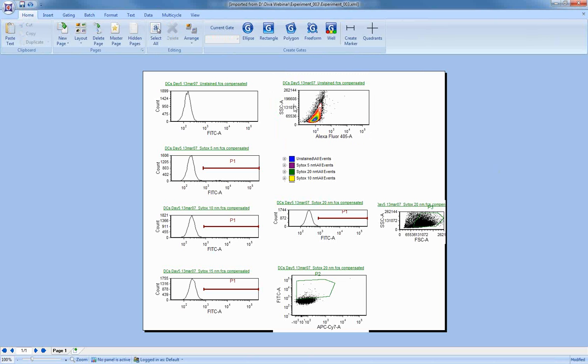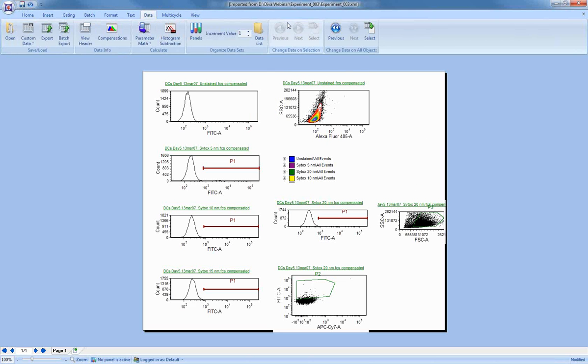The other thing that happened here when we imported it is that all of the files in that folder were imported. So we can go through, using our previous and next, and change the data files on all. Again, these are other topics related to FCS Express. We have many other webinars that are going to talk about them. I just wanted to point out that you can do it inside FCS Express.